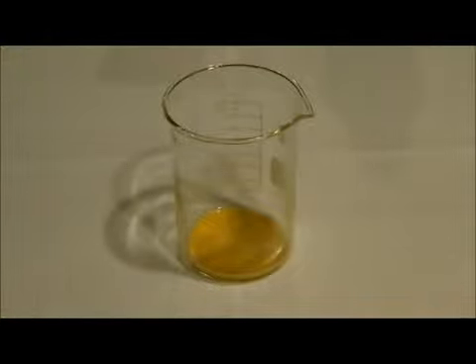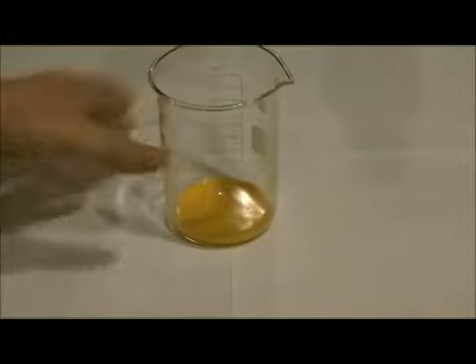I've decanted it about two or three times and now we've got this mustardy colour paste — this is iron oxalate. If you leave it to dry, you'll get this beautiful powder.